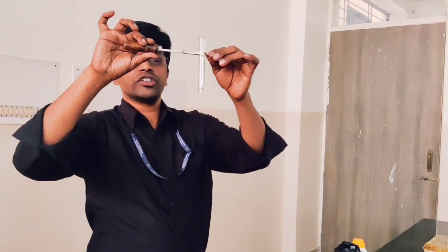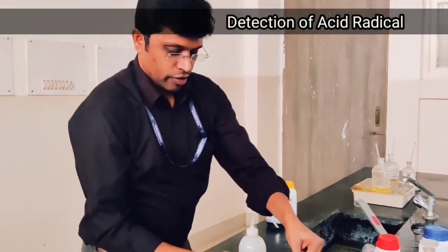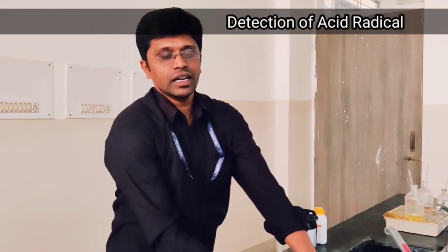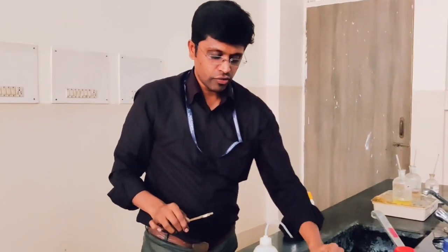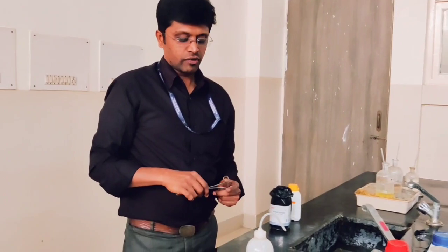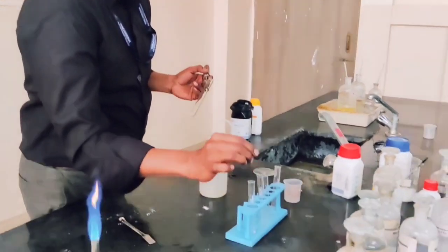So we have finished with the preliminary test. Now for the analysis by group, the first group acid radical will be carbonate. We can perform the analysis of carbonate using dilute H₂SO₄. For that we have to take a pinch of the salt and add dilute H₂SO₄.